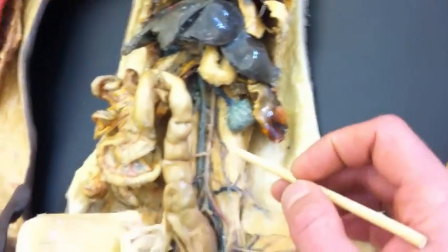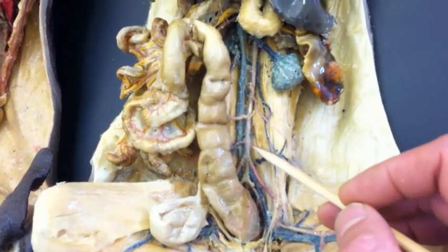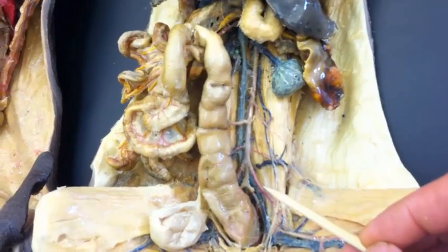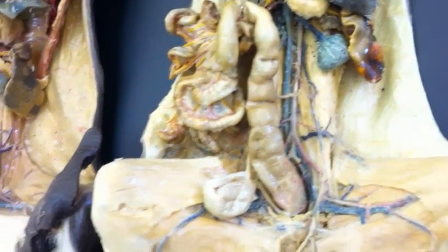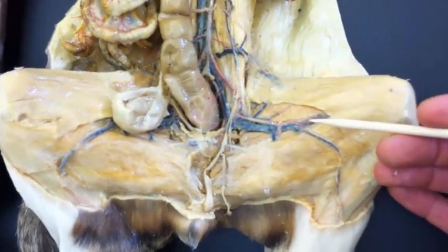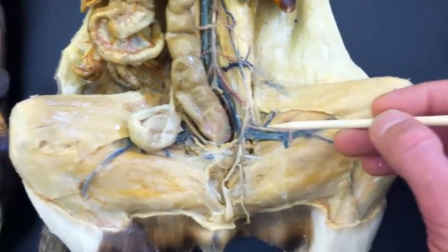Going down into the abdomen again, here's the abdominal aorta and the inferior vena cava. And here we've got a nice branch visible. So here again is the abdominal aorta, and then here is the left common iliac artery and the right common iliac artery. Down in the legs, this cat's got decent arteries in the legs and veins, so we've got femoral artery here and femoral vein, left femoral artery and left femoral vein.